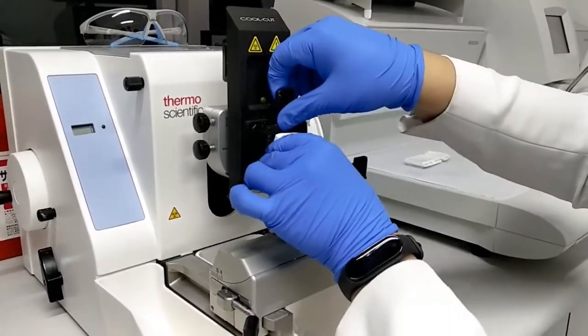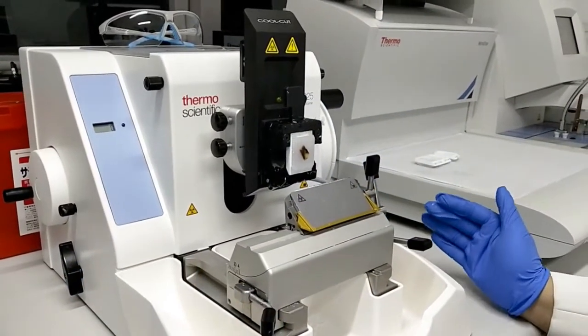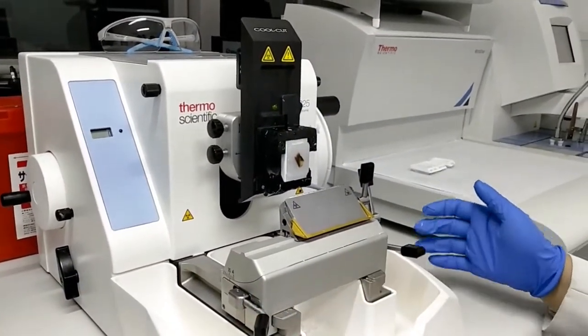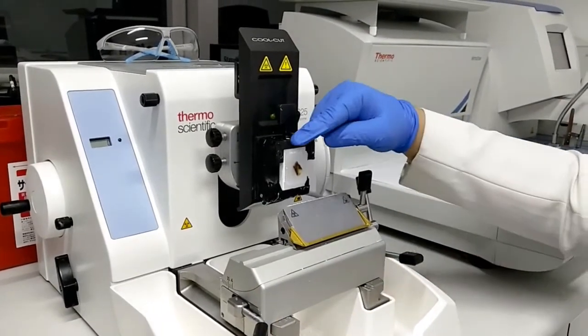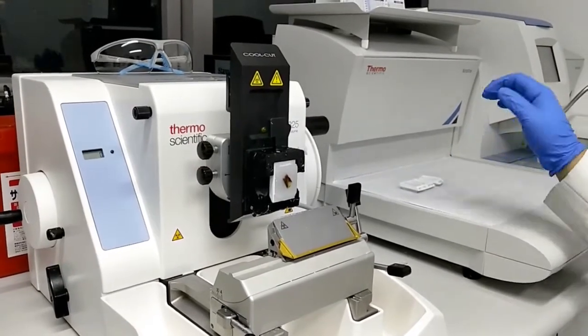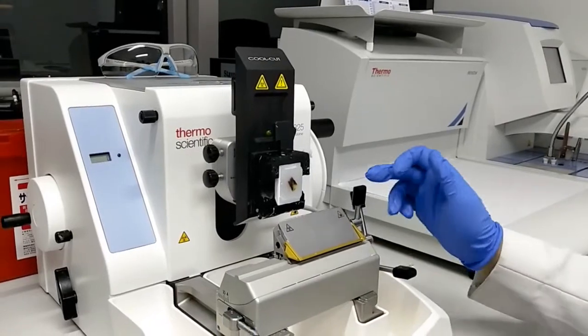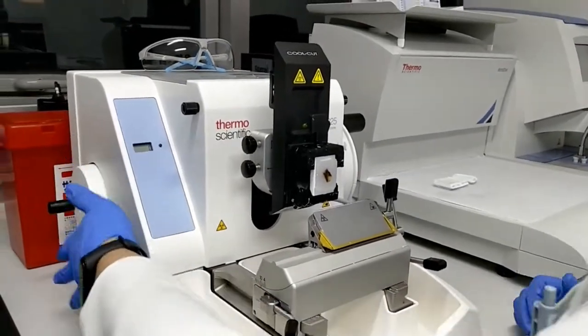In microtomy, it is important that you ensure that your tissue blocks are cold from the cold plate, your blade is sharp, and all the locks and knobs are secured.